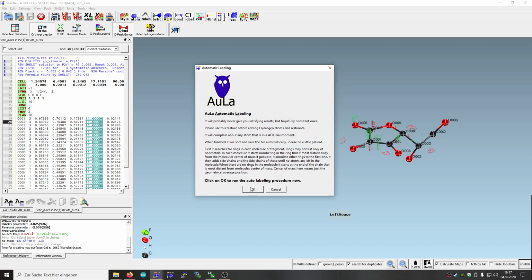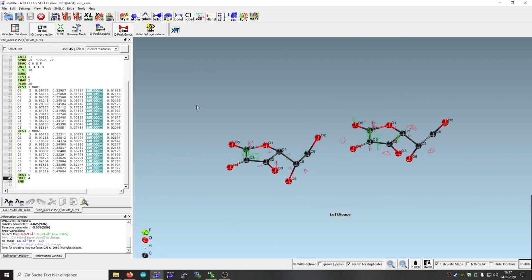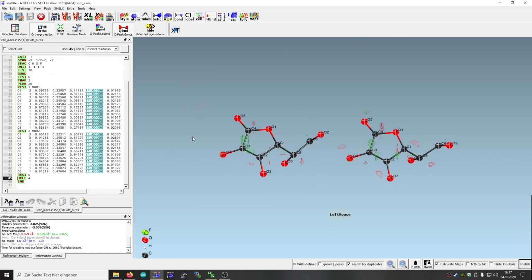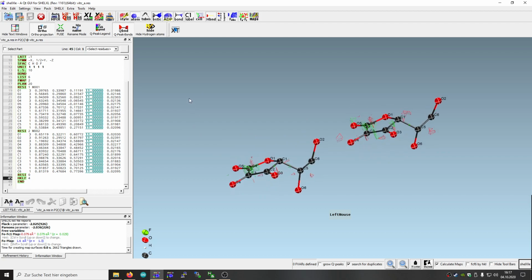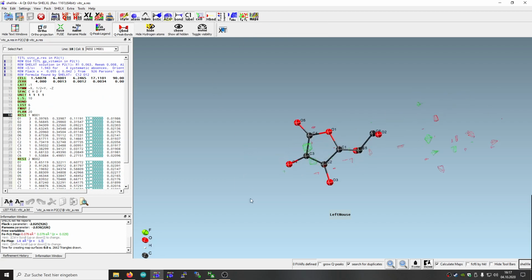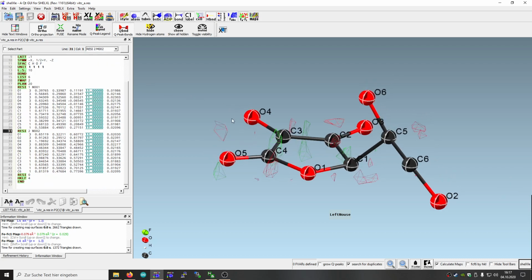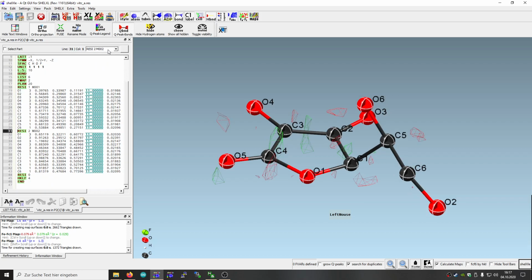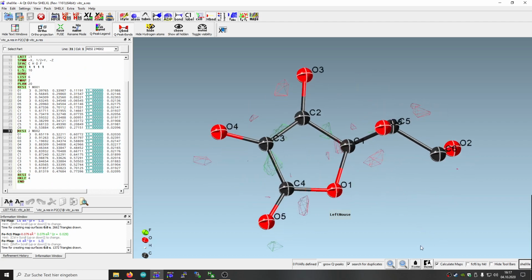just relabel them. So we have two identical molecules, or not identical, same molecules in the asymmetric unit, like here. So this is one with vitamin C, and that's the other one. So you see they're labeled the same way, but there's a small difference in torsion angles, for example.